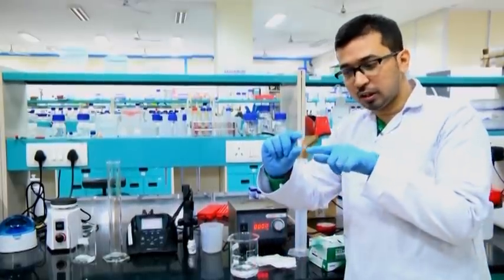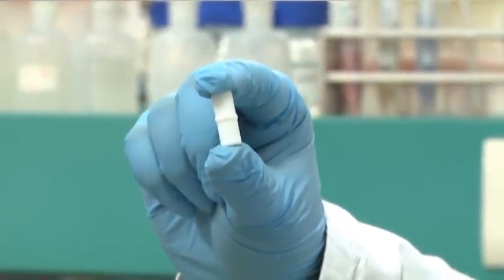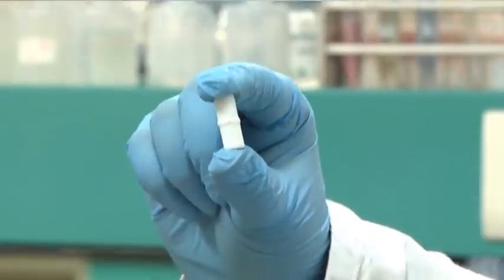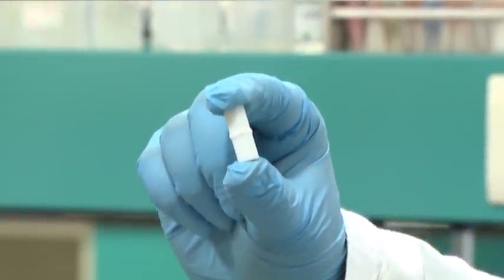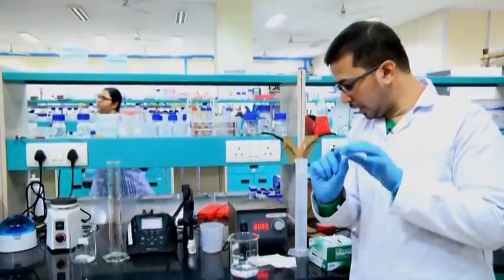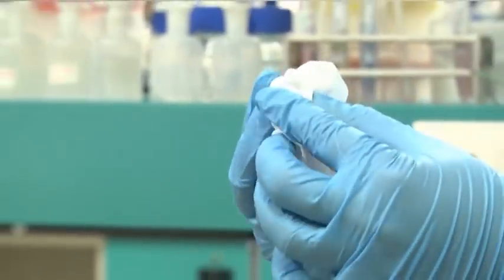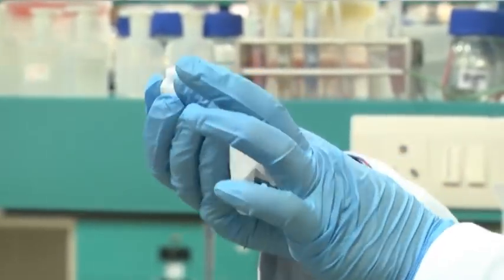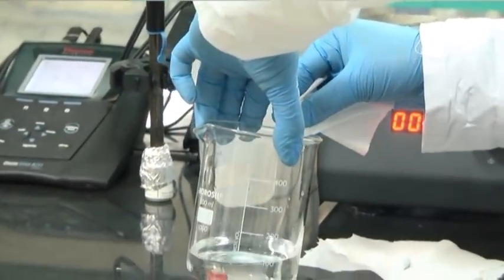These are the small magnetic bars — some of you might be familiar with them. From time to time we will be using this to dissolve solid components in double distilled water or required solvents. This magnetic bar has been previously washed; however, I am again wiping it using a clean kim wipe tissue paper.